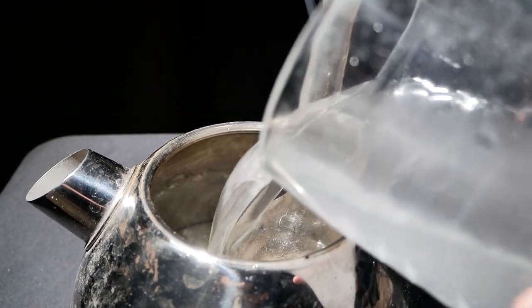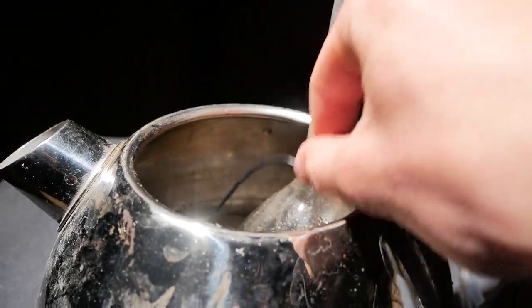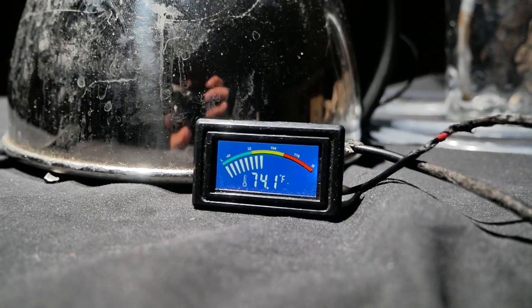Put the water in. I'll be putting a thermometer in the water to measure its temperature constantly. It is now plugged in.